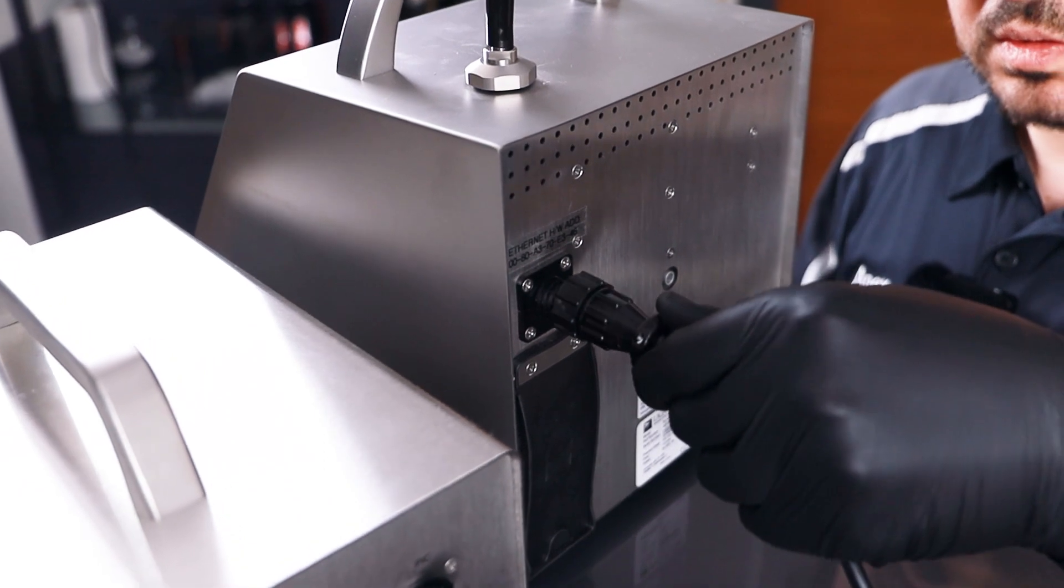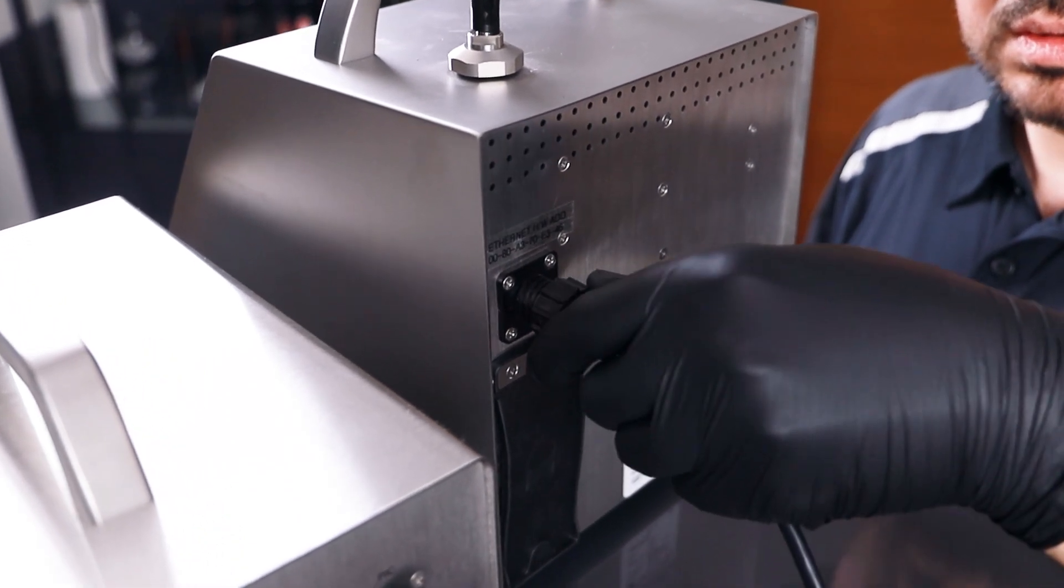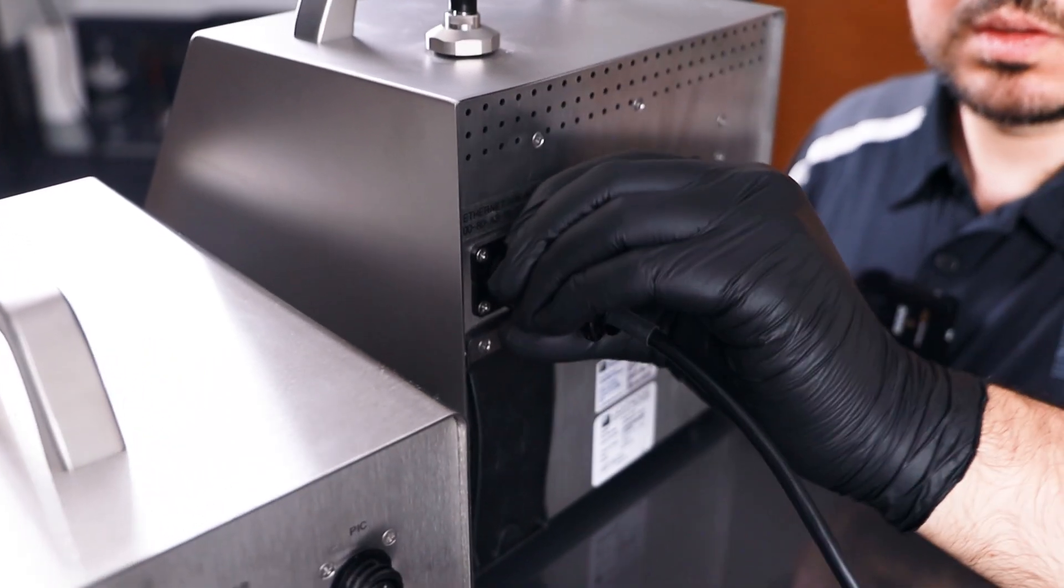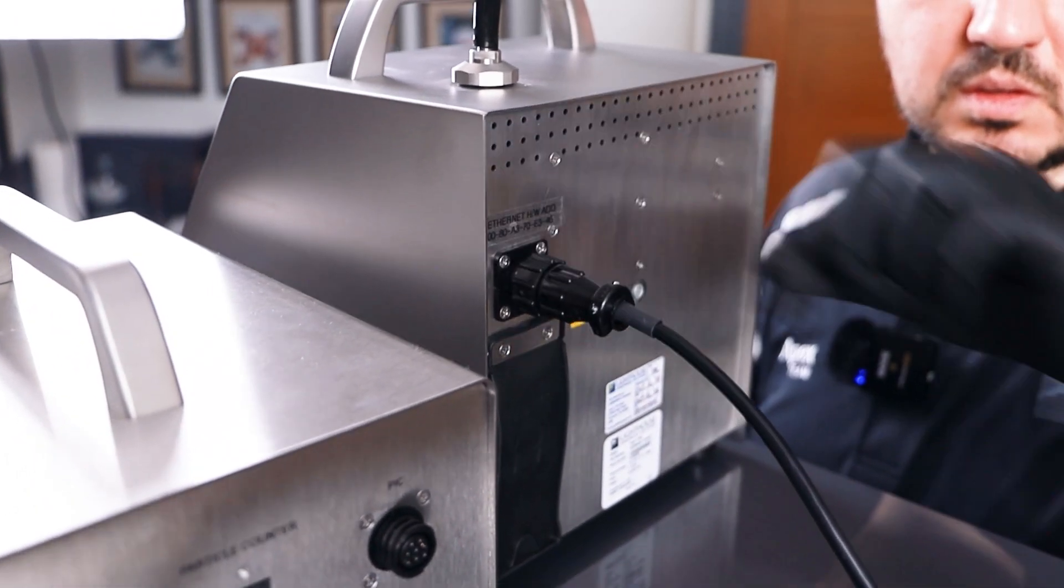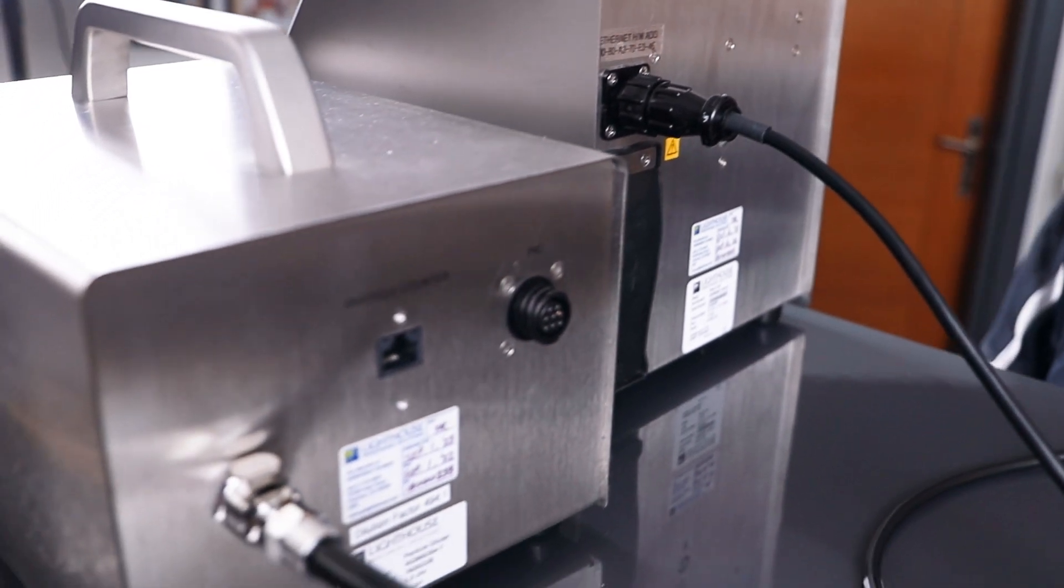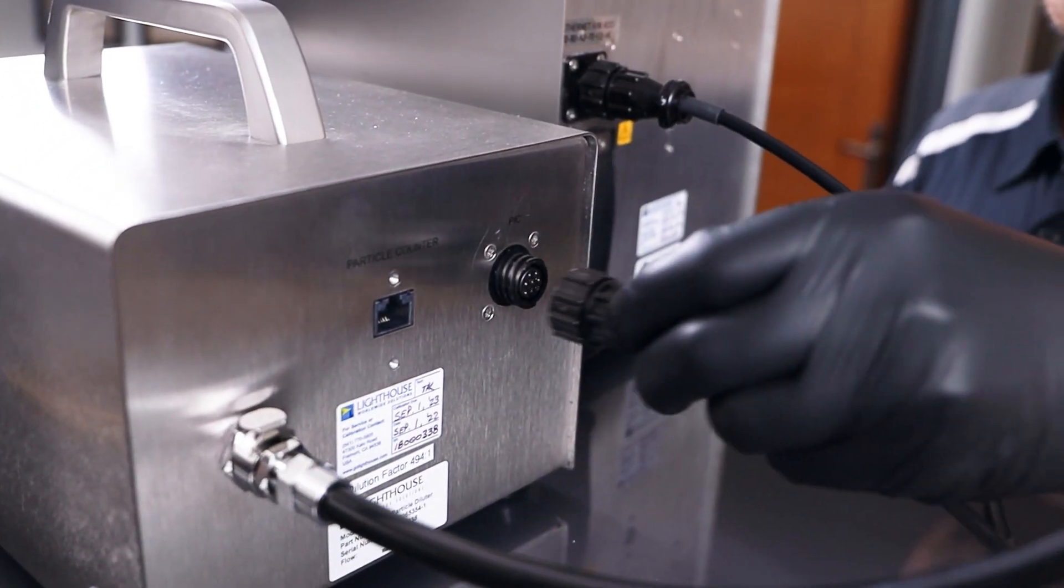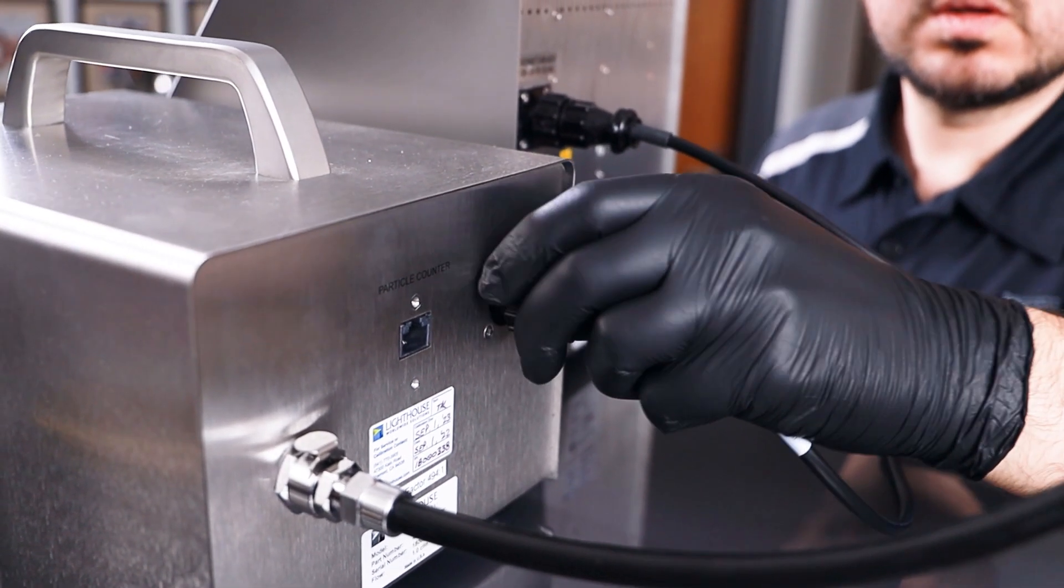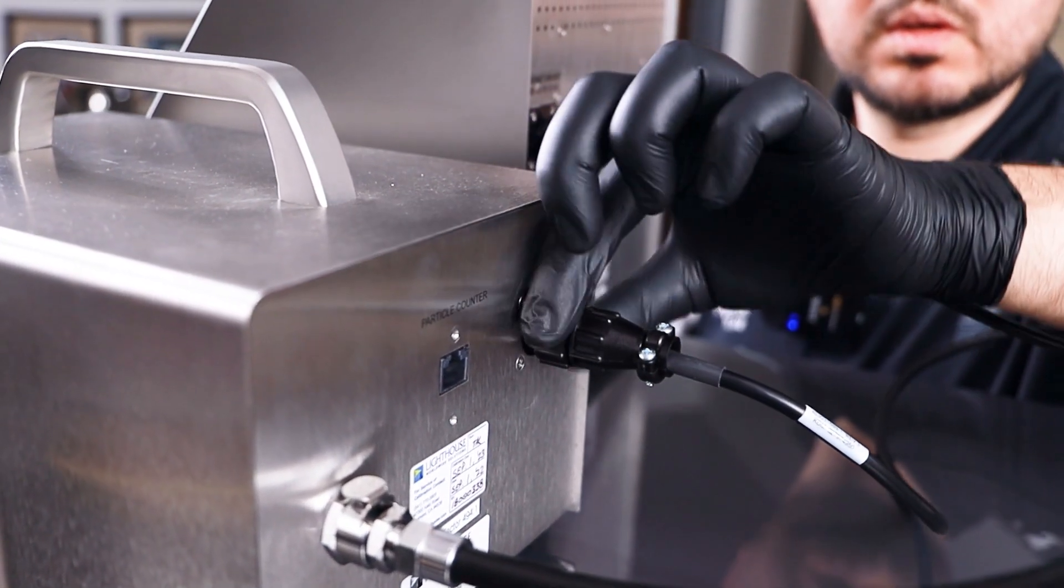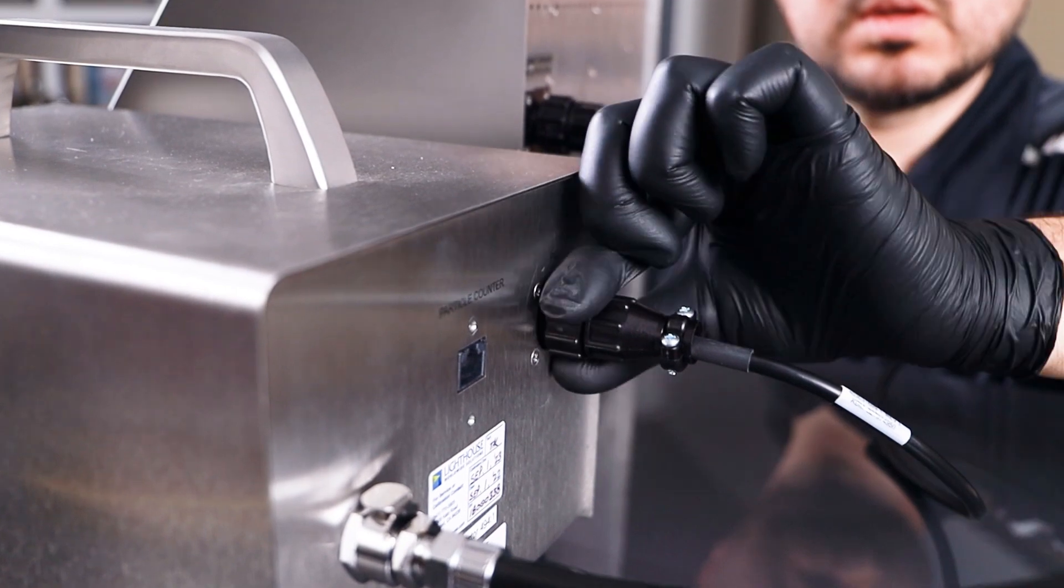Be careful while connecting. Just turn it. You will see that the system will lock. Then you can easily connect this cable. Same thing for the diluter side. First lock it, then connect.